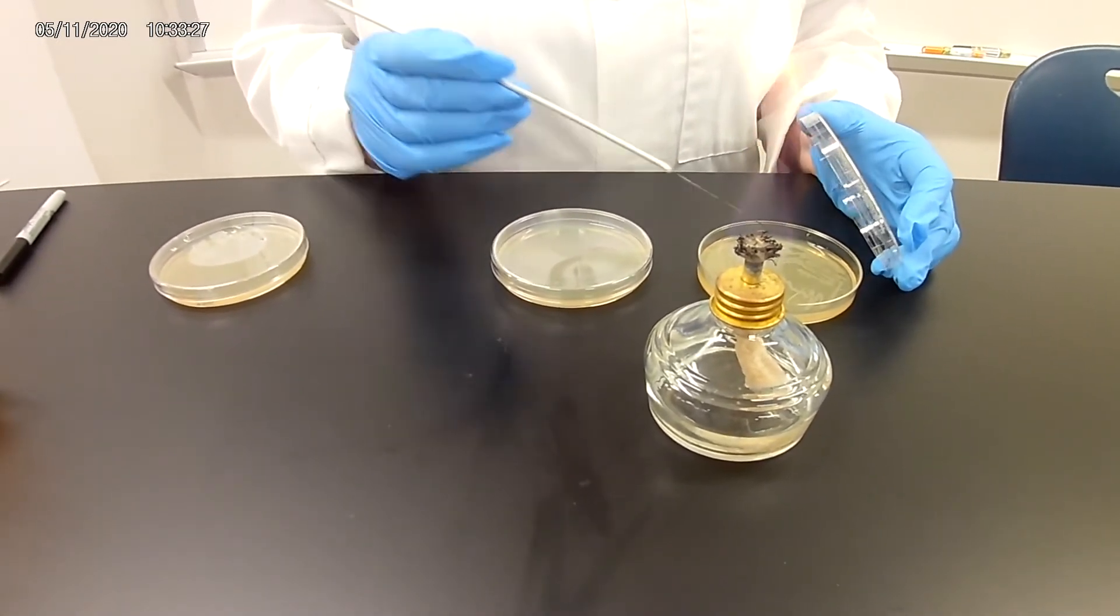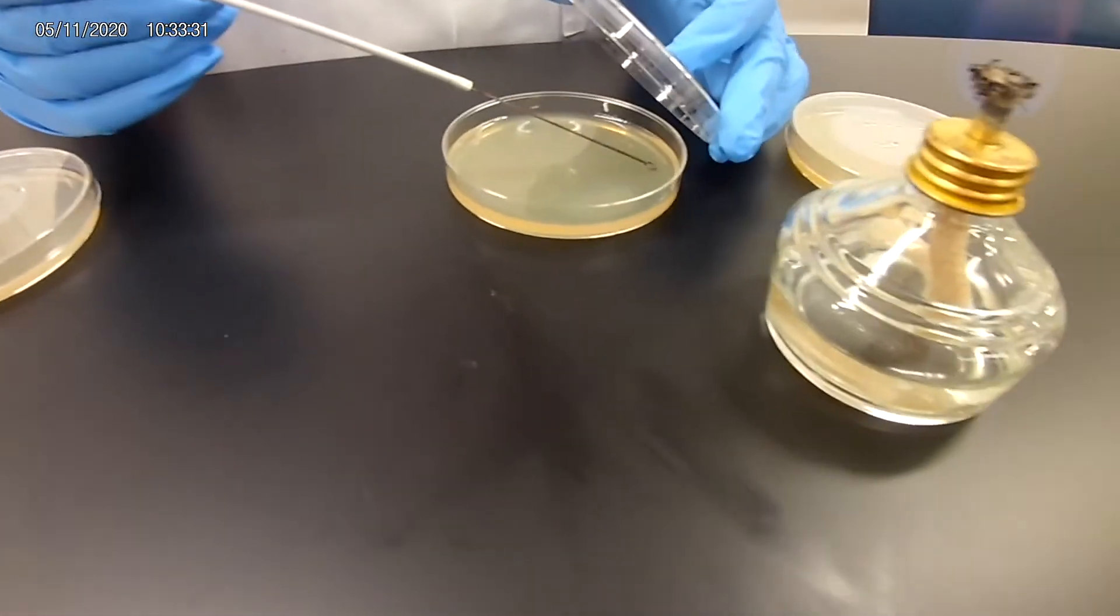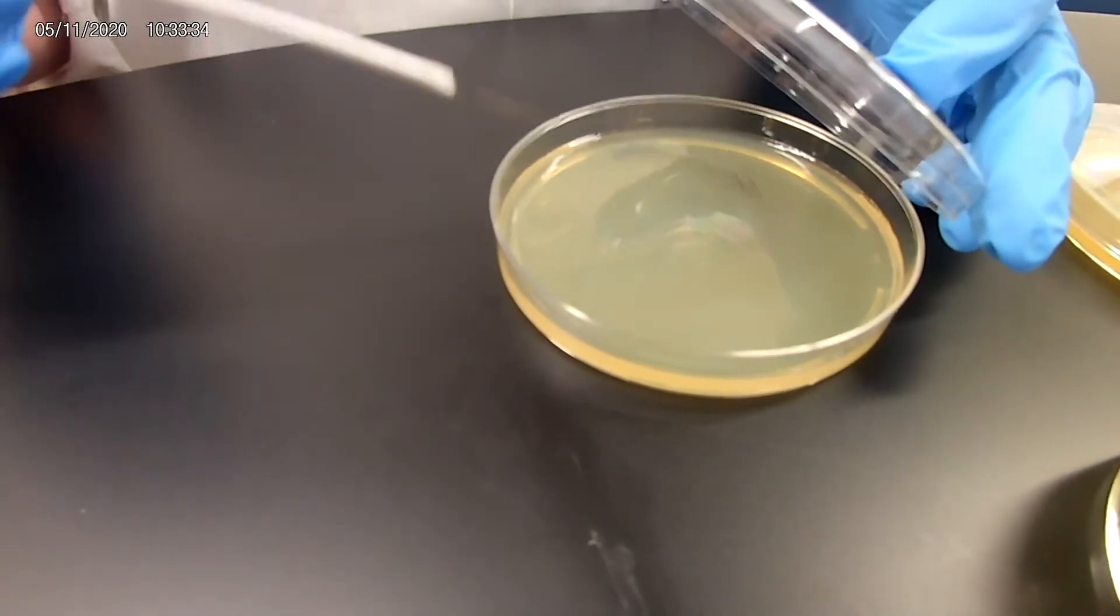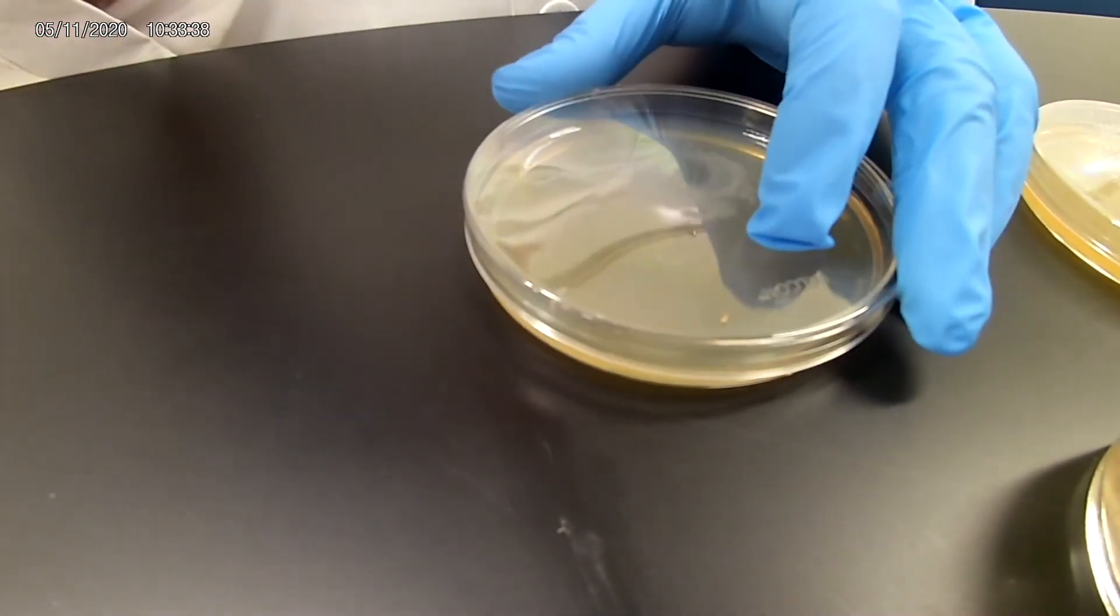So you're going to take your culture. Once again, spread, streak very heavily in this area, flame your loop.